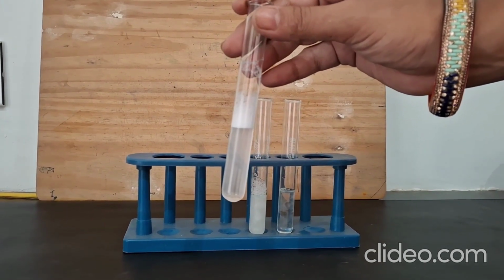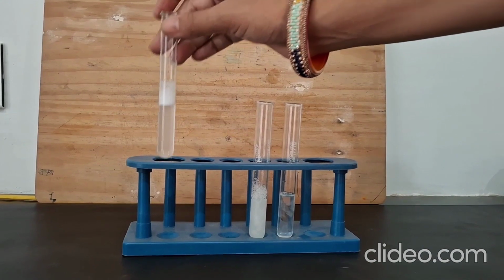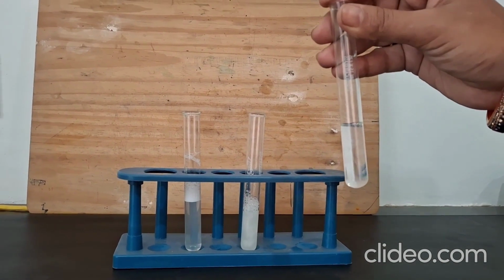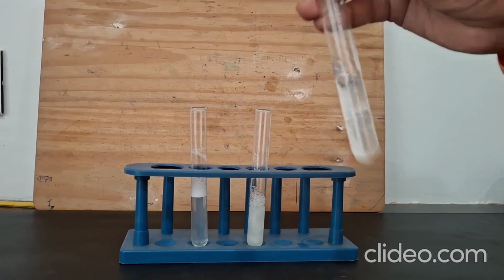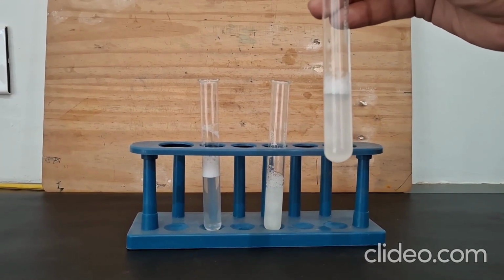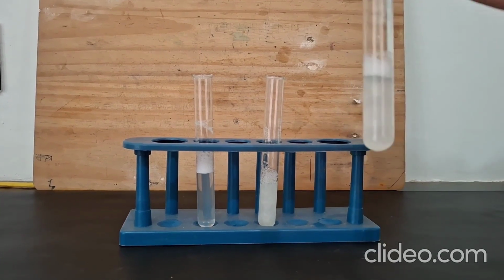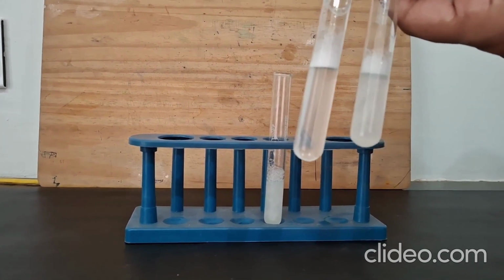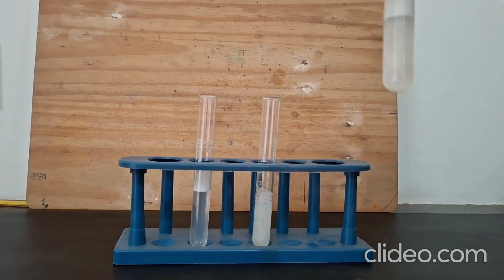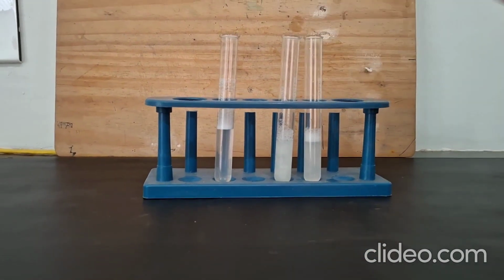Look at the amount of lather that has been formed. You can see the lather formation has occurred in soft water. And when we shake this test tube, which has hard water along with soap solution, see, the solution is slightly milky and the amount of lather formed is much less as compared to the lather formed with soft water. If you want to see the formation of scum, you can keep this test tube containing hard water solution for some time, and you will find the lather settling down and forming a white layer on the surface, which is called scum.